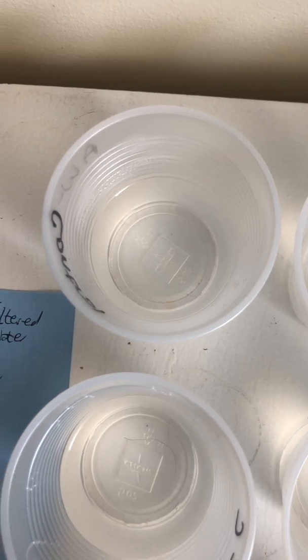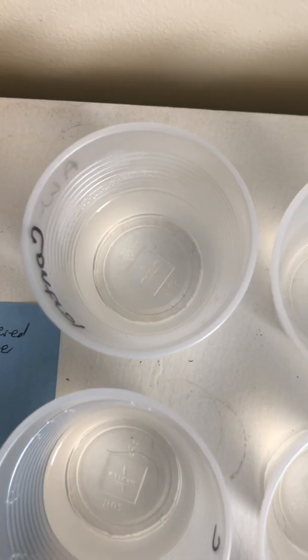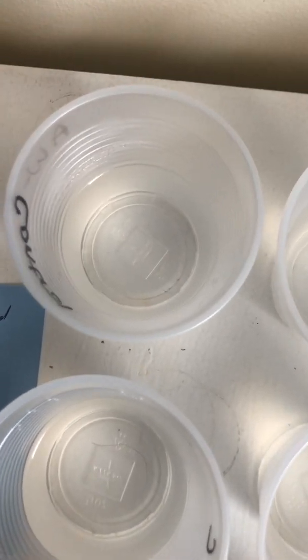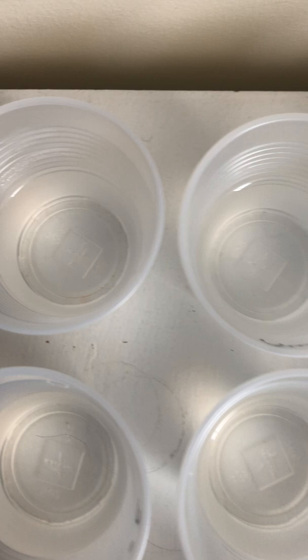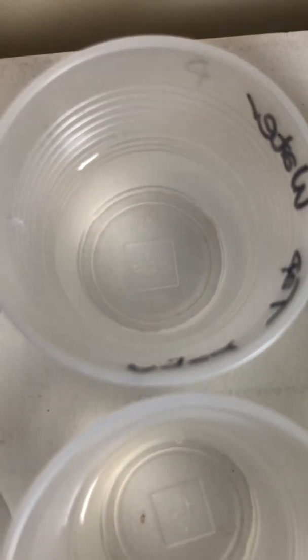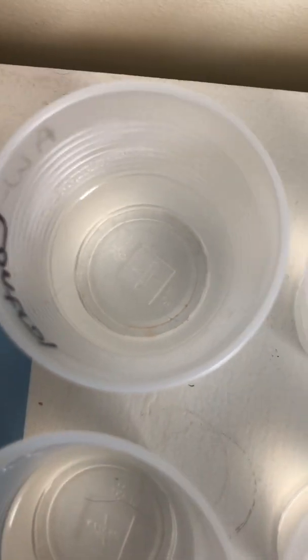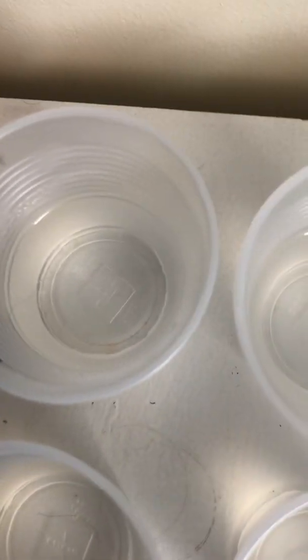Remember, the point of the control is to show the presence, right? We're looking at a qualitative analysis, the presence or absence of things, and we have to compare what we find versus our control. So even though we found some growth in the aged tap water with phosphate, because we also found it in the control, we cannot say, according to our lab, that the presence of this red organism is because of the phosphate, because it is also present in the control.